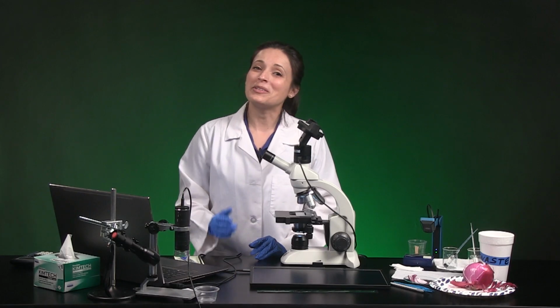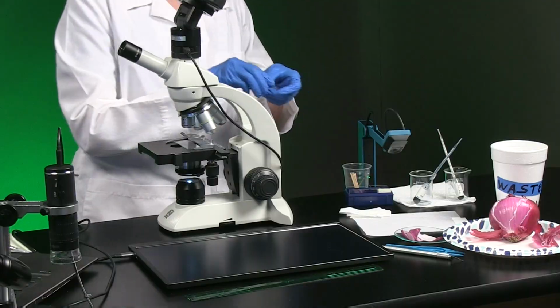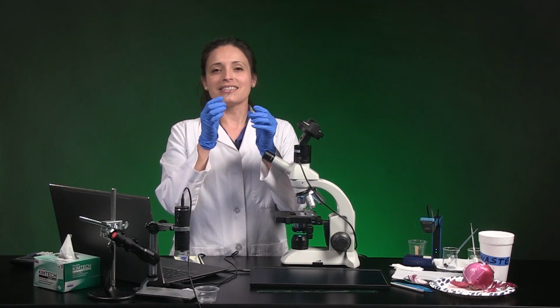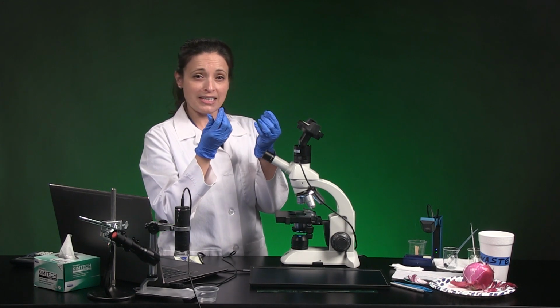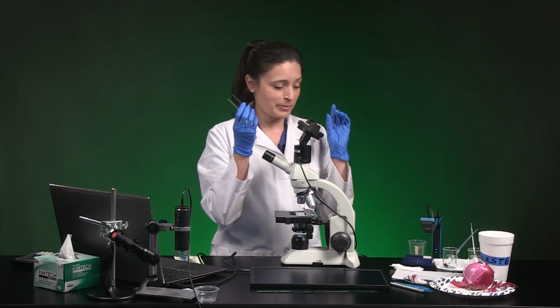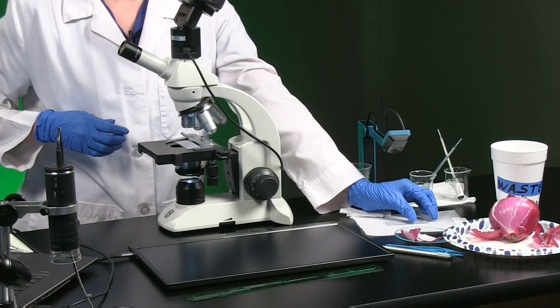In this part, we're going to look at animal cells donated by me, a mammal. First, I'll grab a clean glass slide and cover slip by the edges and inspect. I'm looking for a chipped or cracked glass, but these look fine. If it's chipped or cracked, I need to discard it in the broken glass container, but I'm just going to set these on the paper towel since they're not chipped or cracked.